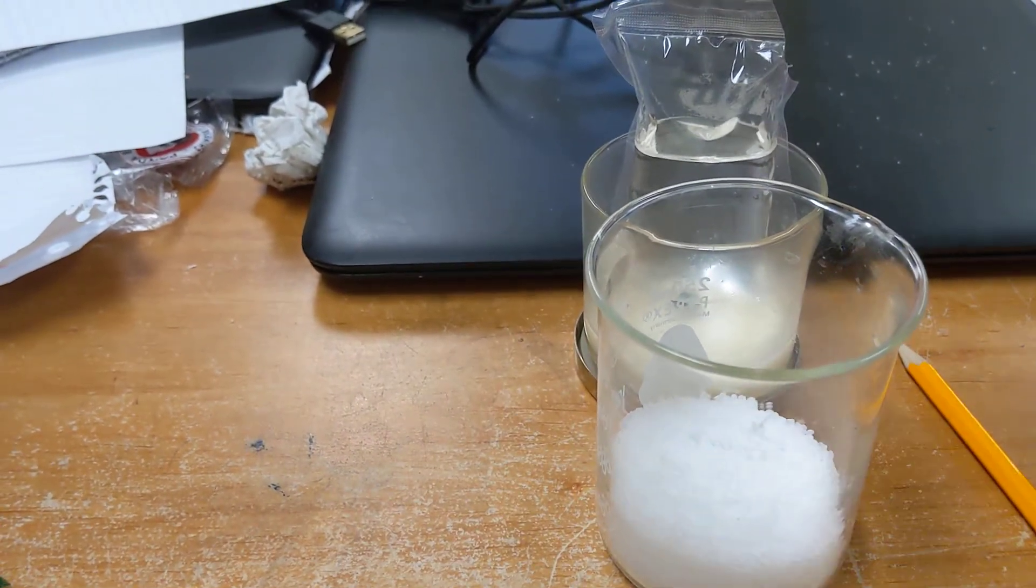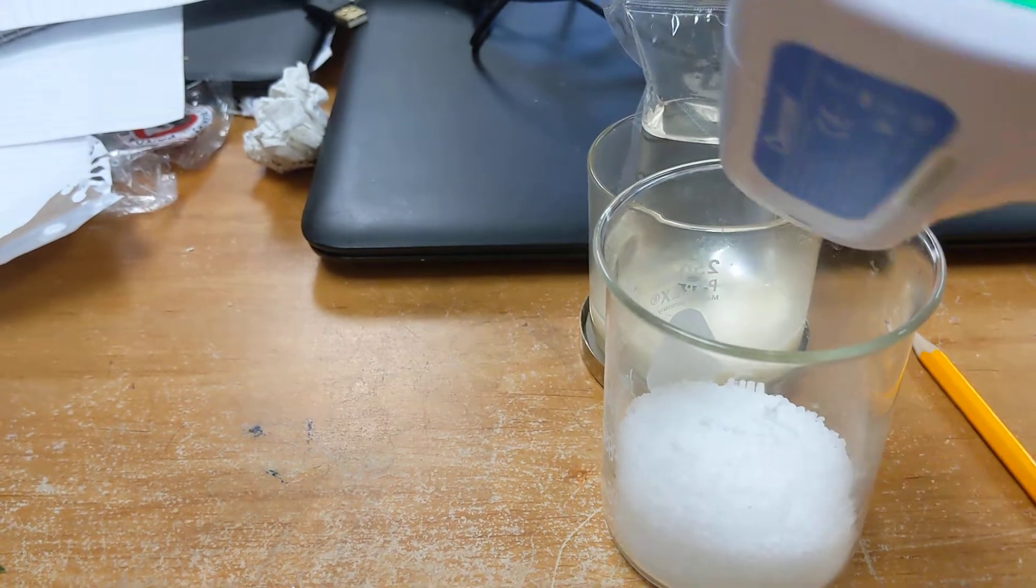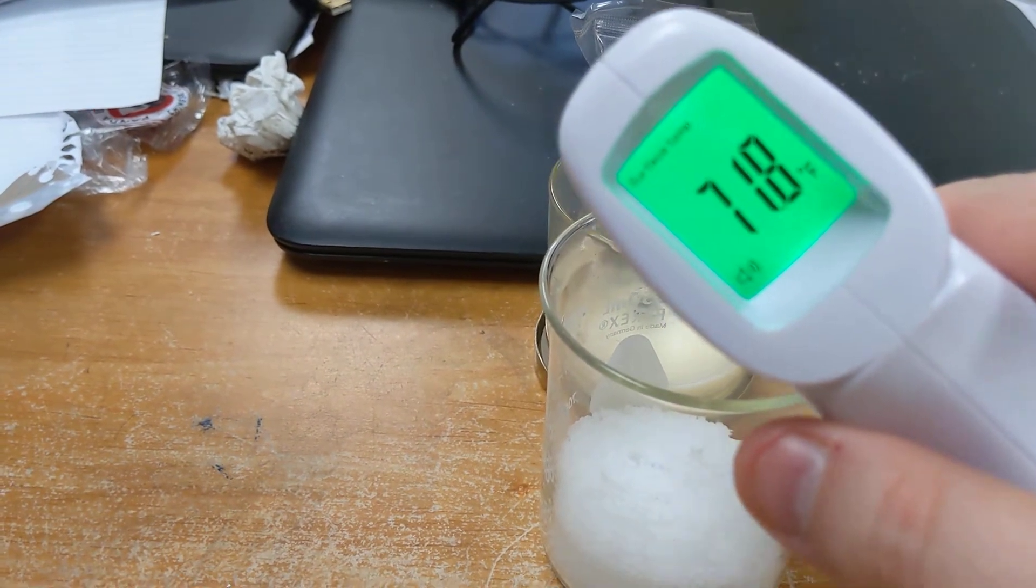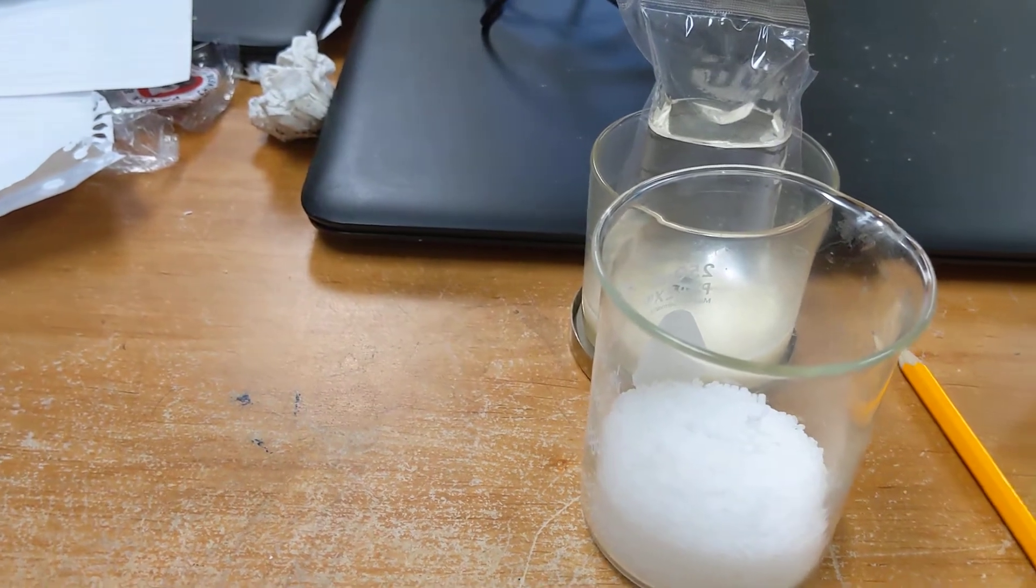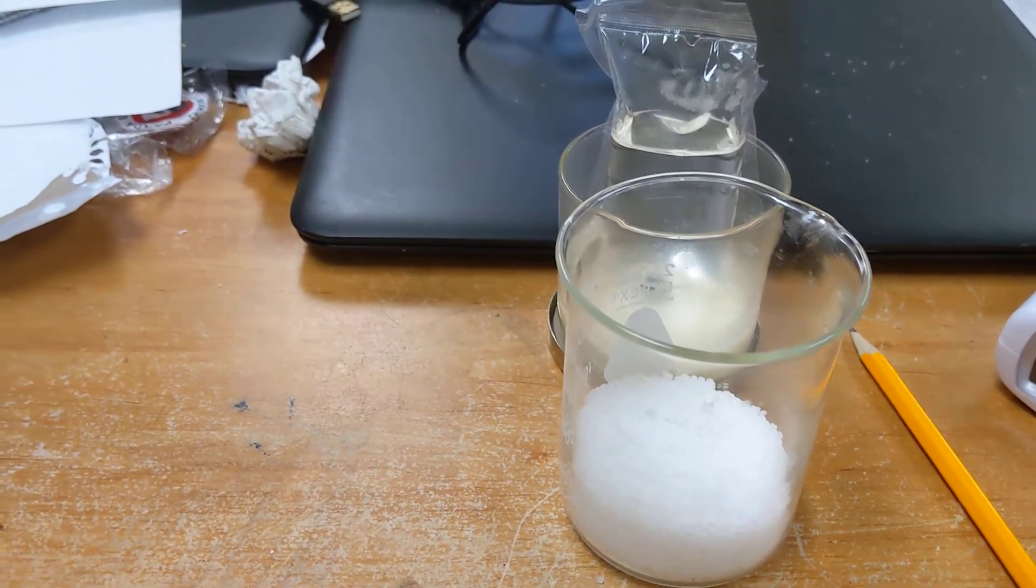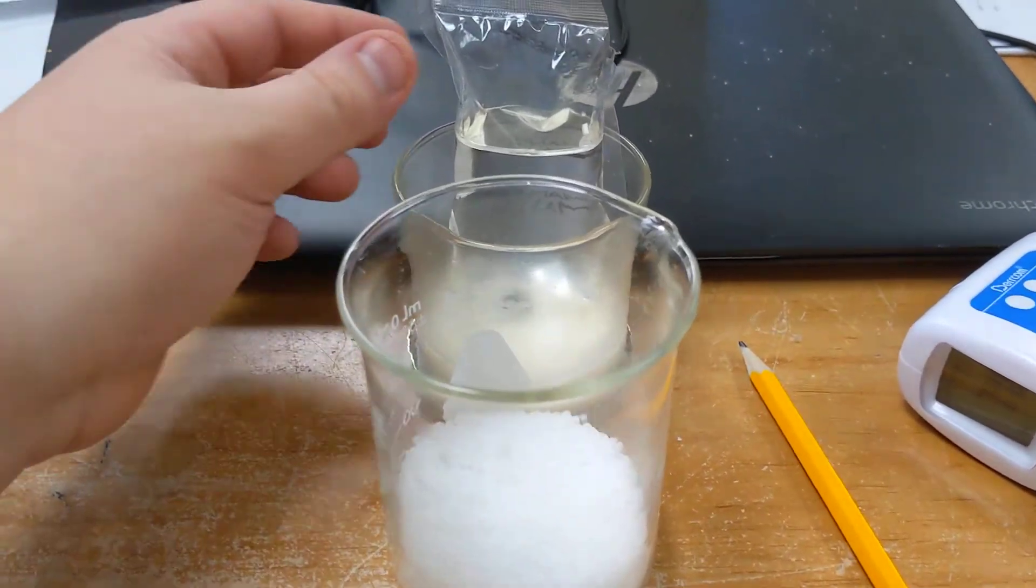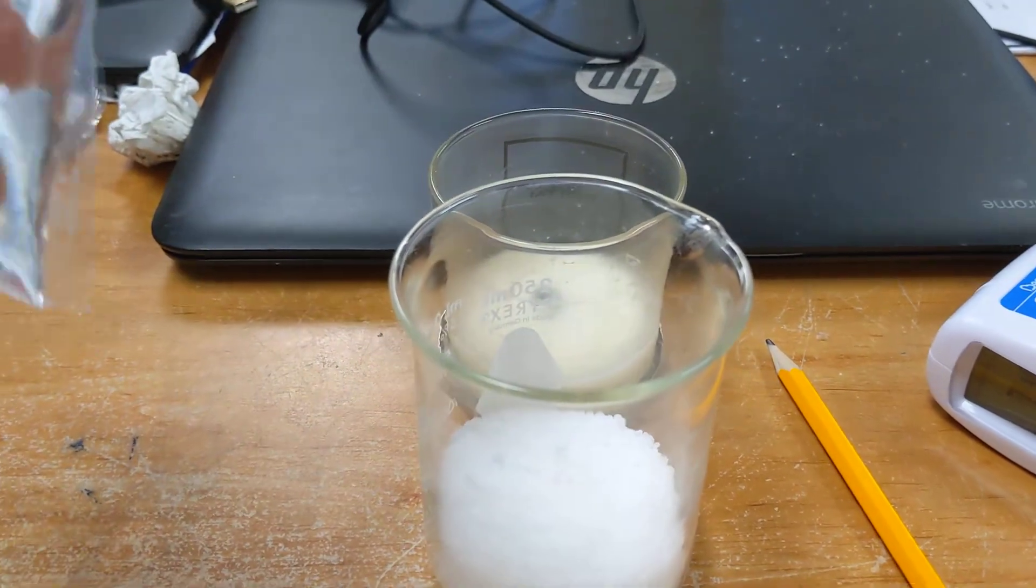Now our starting temperature for everything is 71.8 degrees Fahrenheit. When we mix these two together, we're going to see a chemical reaction that causes a temperature change. Here is the water.